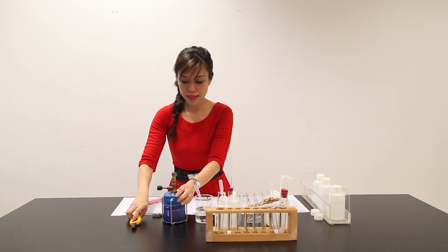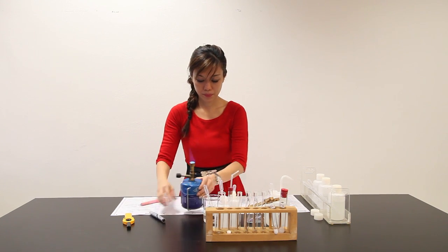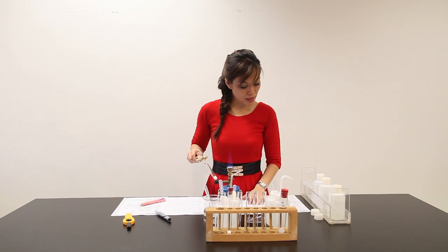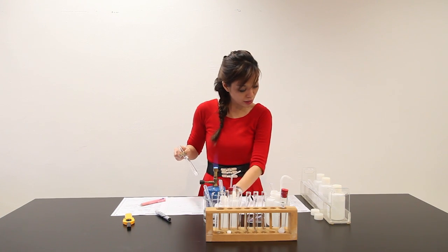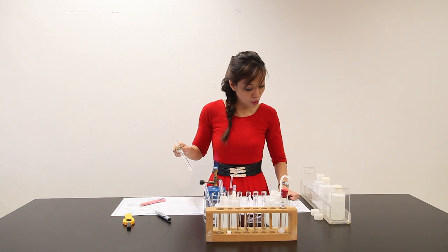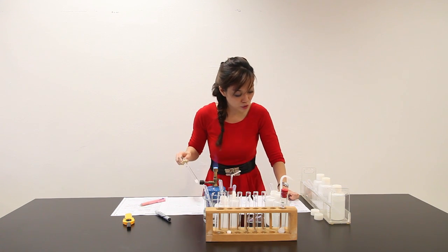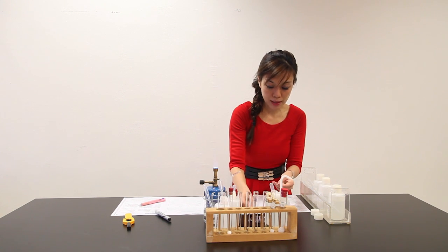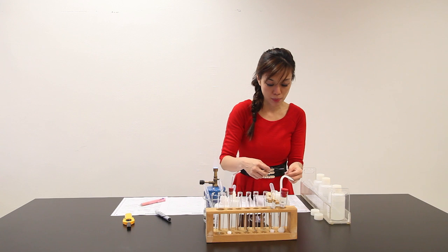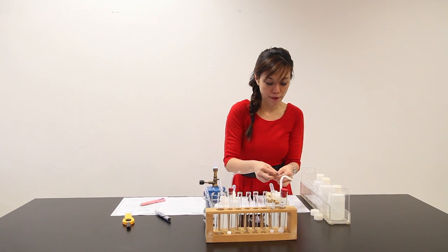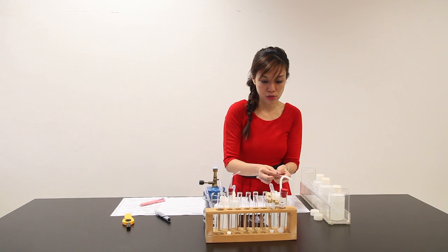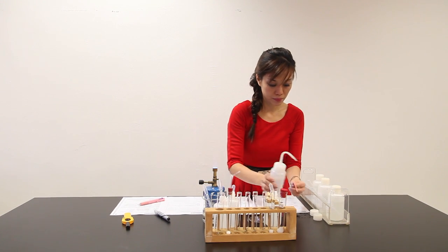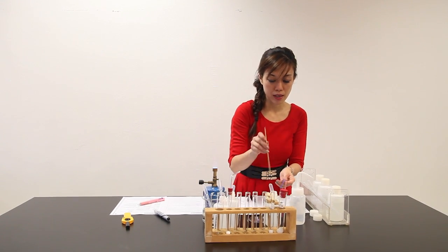Let me light up the Bunsen burner right in front here. I'm supposed to heat this gently and then strongly for about a few minutes, and also test any gases involved during this process. So let me prepare my litmus paper.